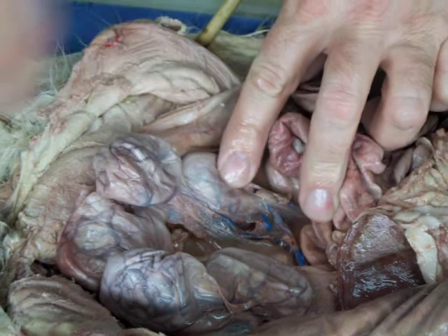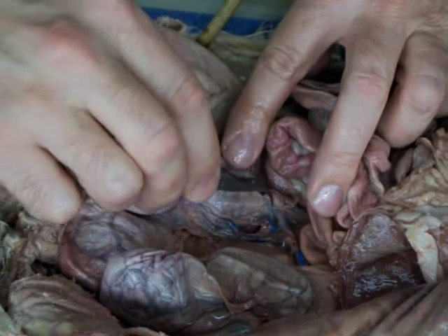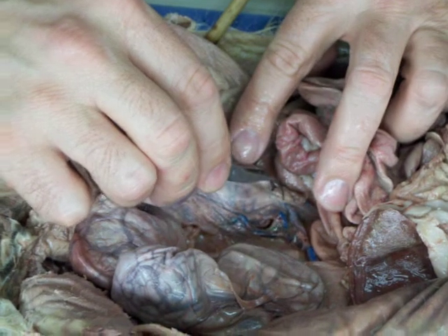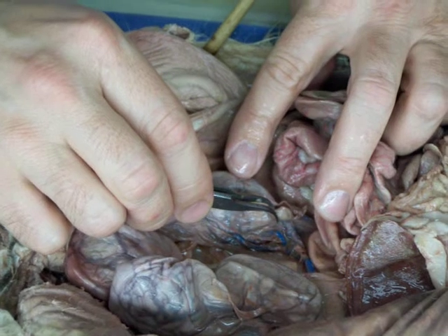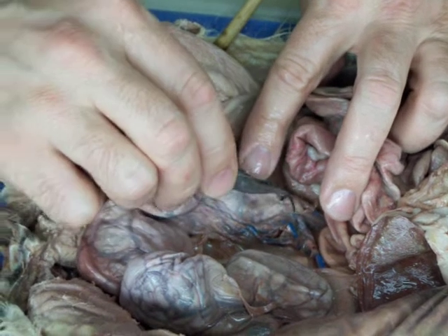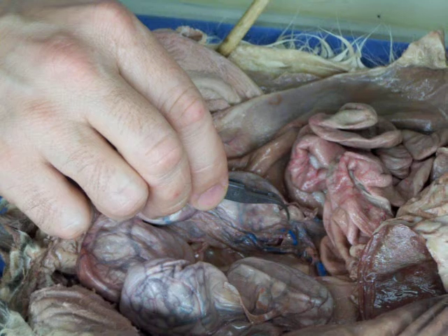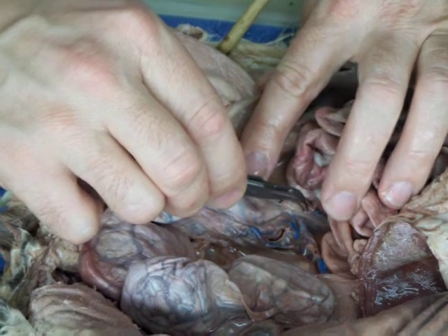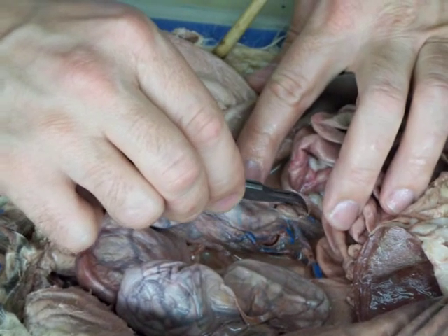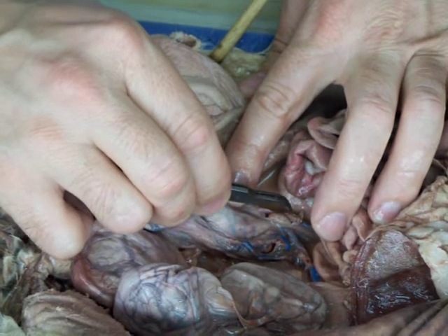Now on this ovary you can see the ovary sits in that pouch. See that little pouch of mesentery? That's the infundibulum. And the infundibulum forms a little basket around the ovary. And the edges of the infundibulum, and you can see them here, see that little frilly-like edge on the rim? That's the fimbria.